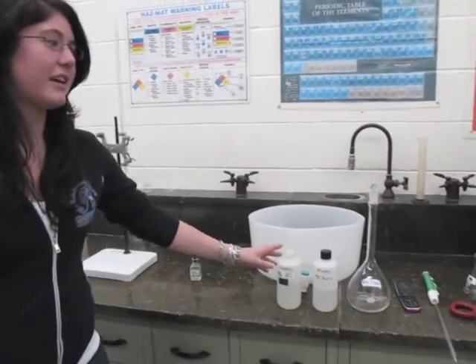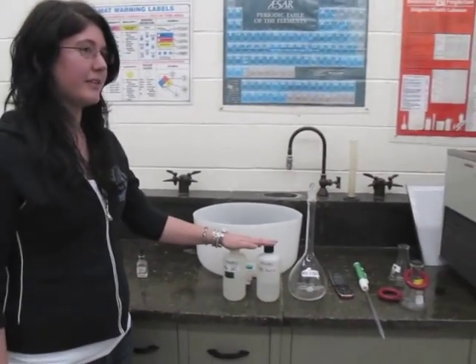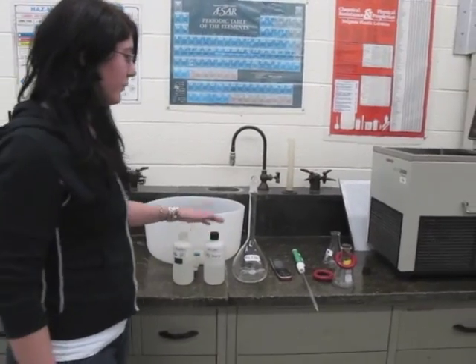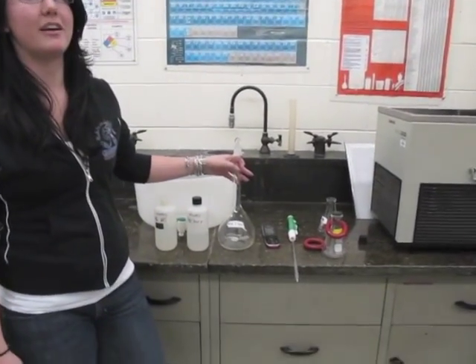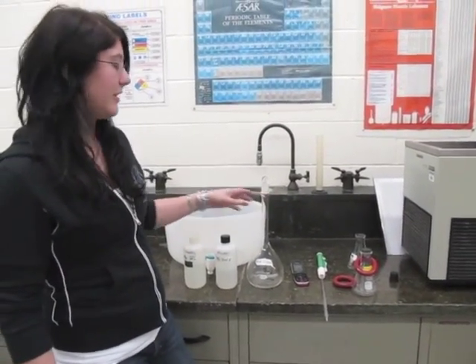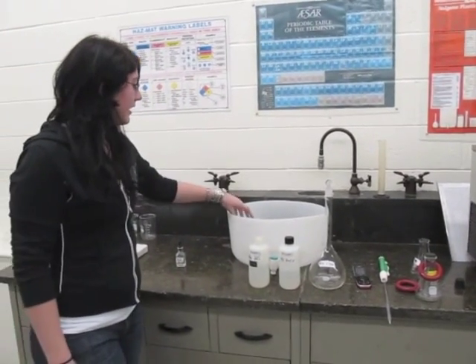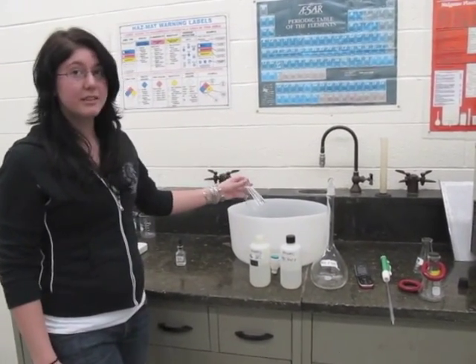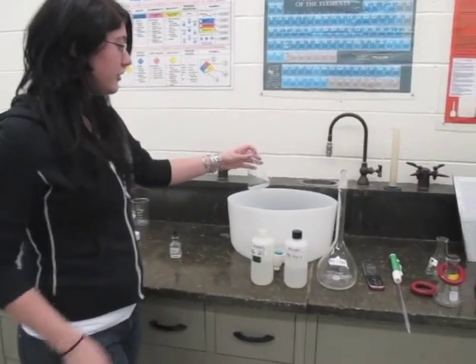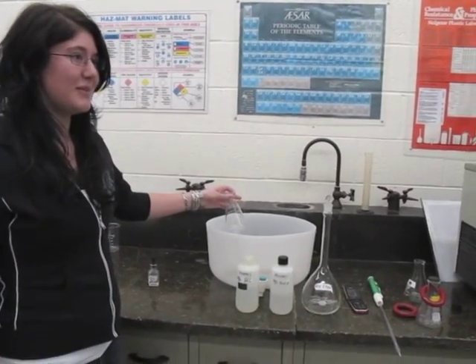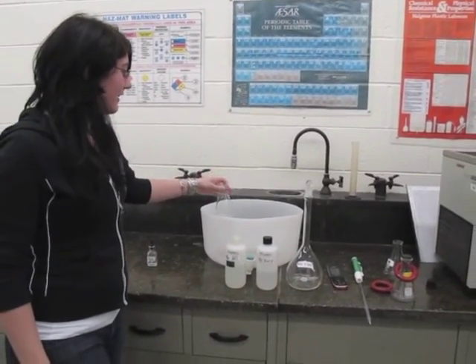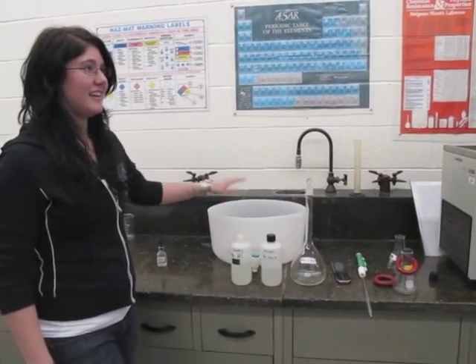The sodium hydroxide and hydrochloric acid were taken from the stock solution, and one liter of isopropyl acetate was prepared as stated in the solutions manual. We also have an ice bath, and we measured out six milliliters of hydrochloric acid into a bunch of different 250 mL flasks, and they are sitting in the ice bath.